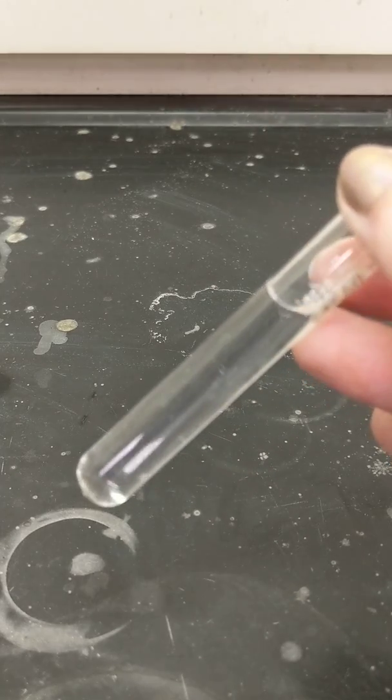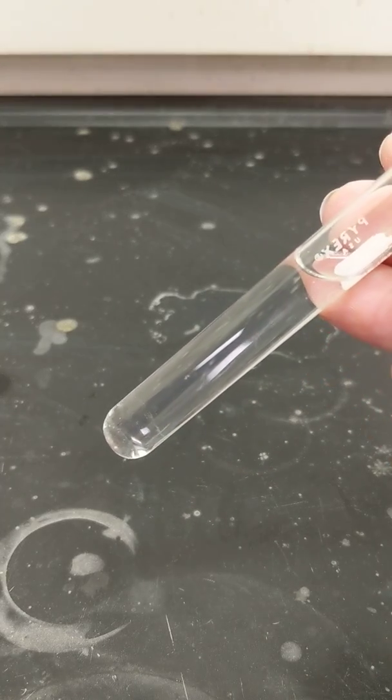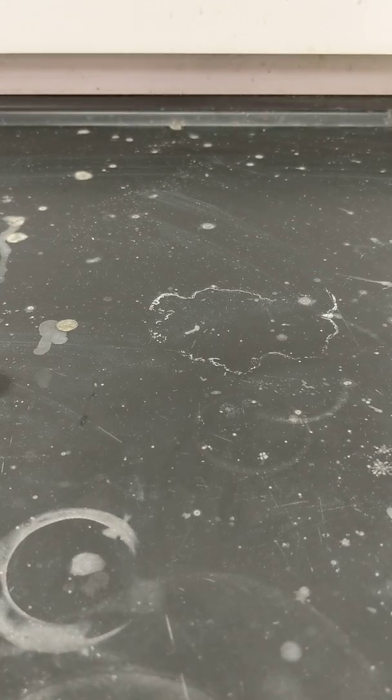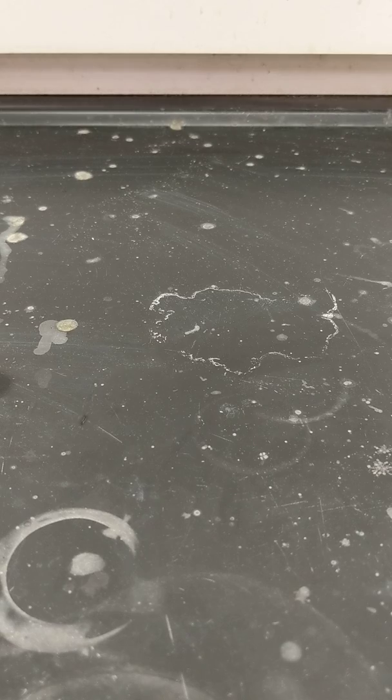Reaction 7 still appears as before mixing because the bubbles have dissipated.